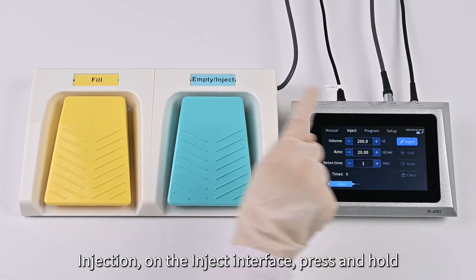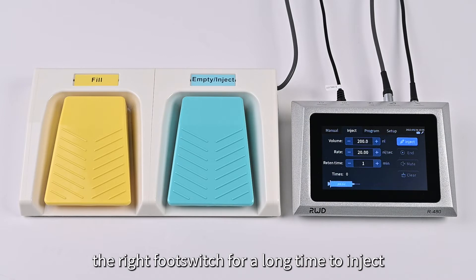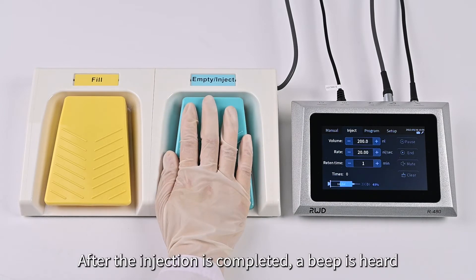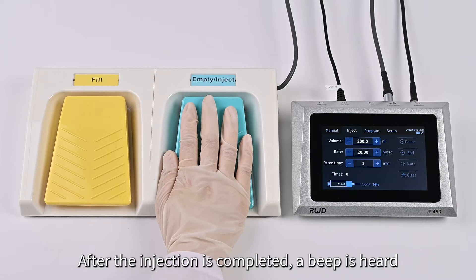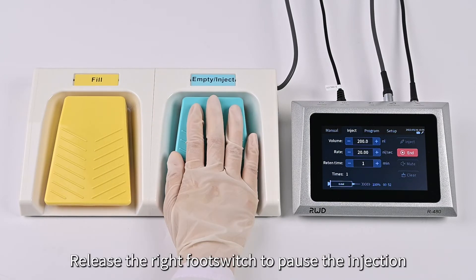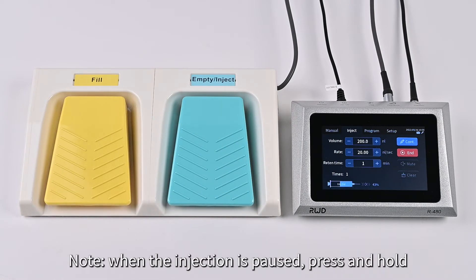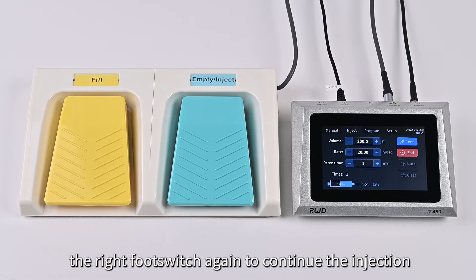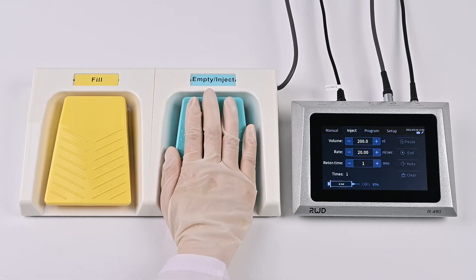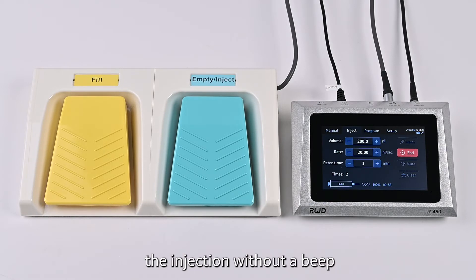For Inject: on the inject interface, press and hold the right footswitch to inject. After the injection is completed, a beep is heard. Release the right footswitch to pause the injection. Note: when the injection is paused, press and hold the right footswitch again to continue the injection. Pressing the left footswitch will finish the injection without a beep.